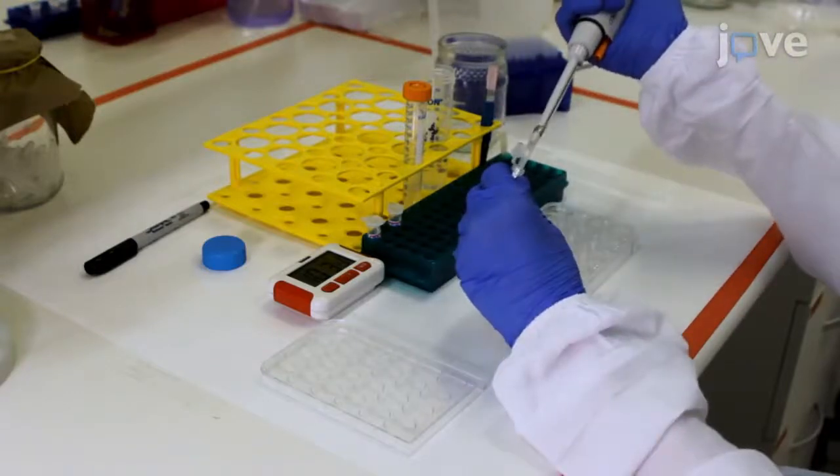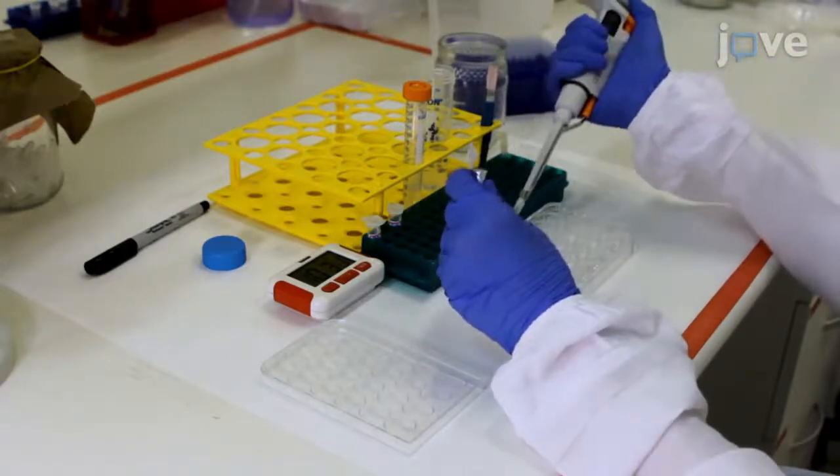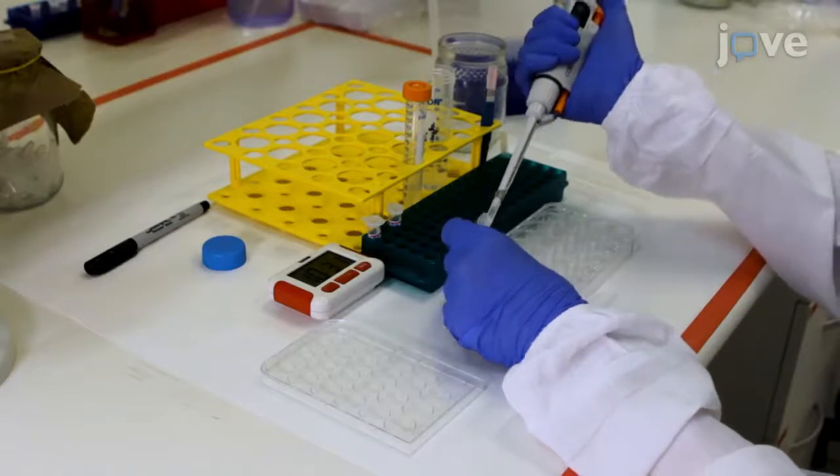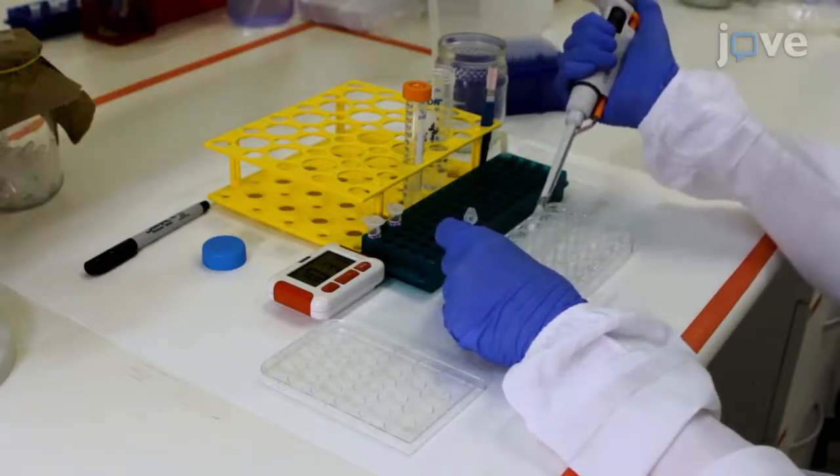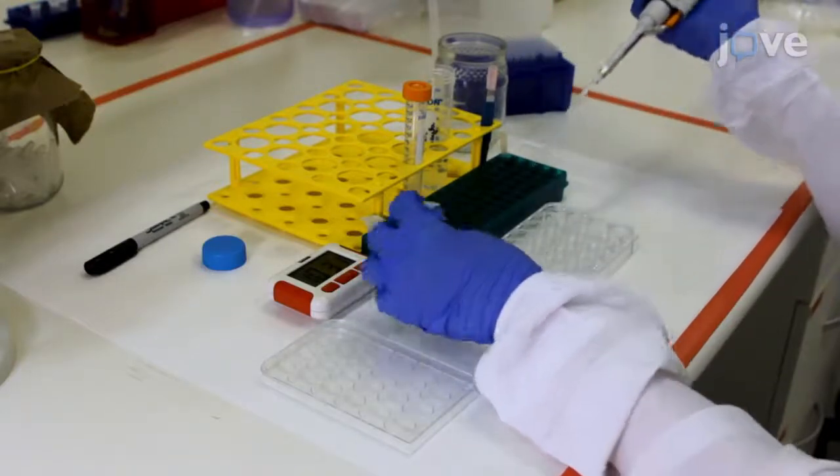Since there are only few commercial antibodies available to recognize specific cell structures and proteins in parasites, this protocol can be very useful.